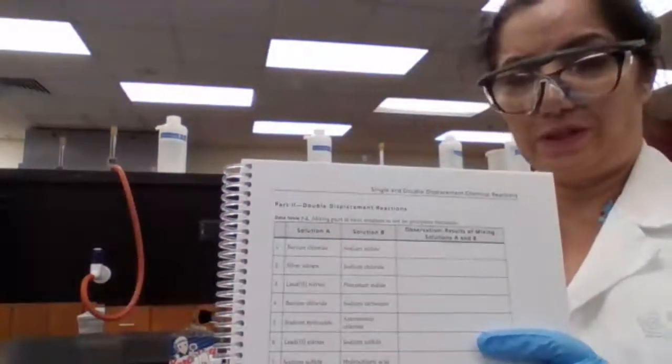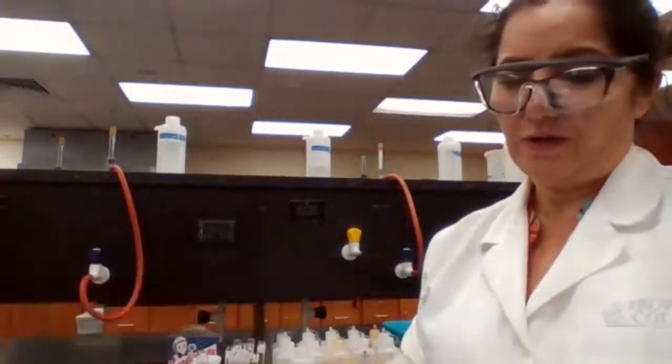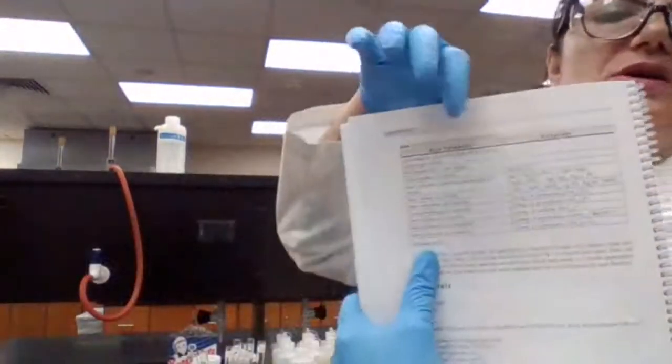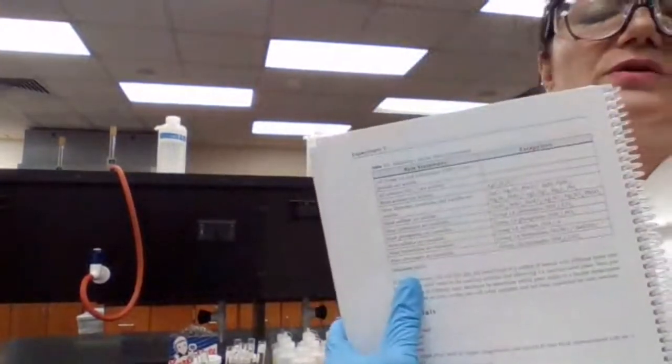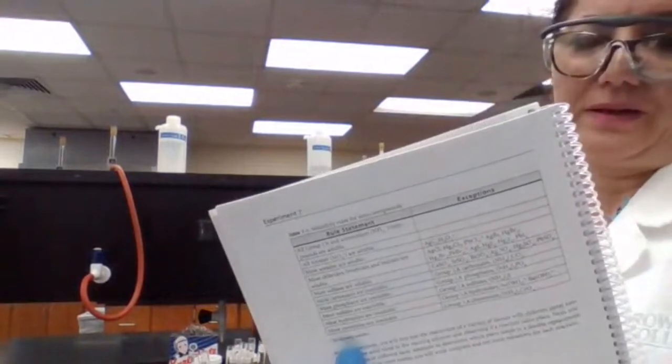Now, if either barium sulfate or sodium chloride is insoluble in water, you are going to see formation of a precipitate in the aqueous solution. If one of the products forms a precipitate, that's the evidence for reaction. You know one of your products is not soluble. You can actually predict based on the solubility chart if a precipitate is going to form or not, and you can identify what the precipitate is.